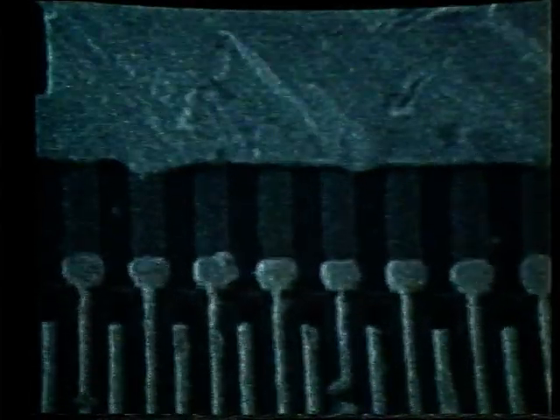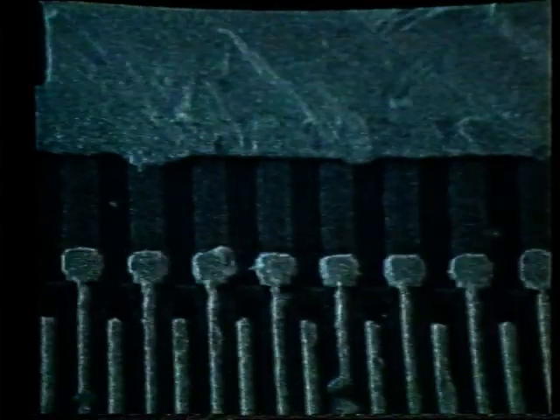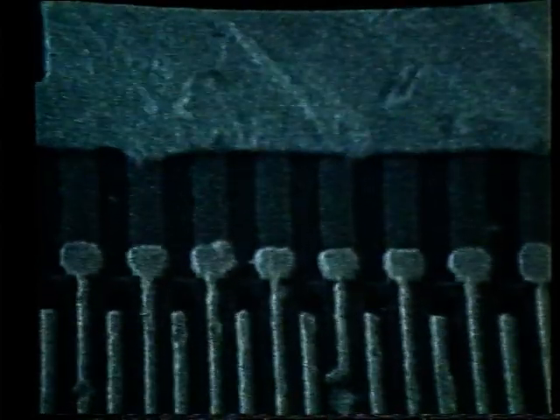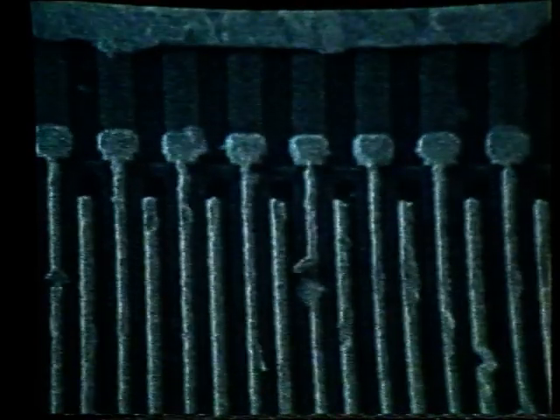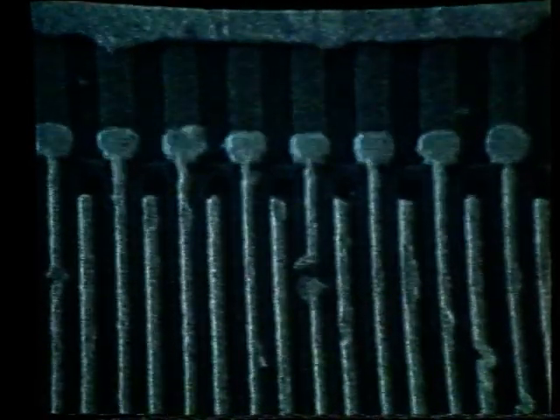So let's begin with the up-down arrows in order to change the value of Y. And let's also use the shift key so that we can do it rapidly. It looks like the rocking is worse in that direction. So let's go in the opposite direction. Looks like it is better, much better here.